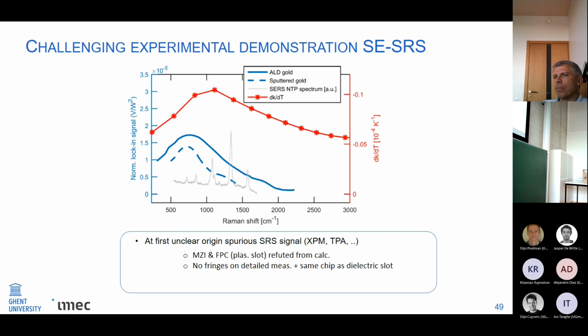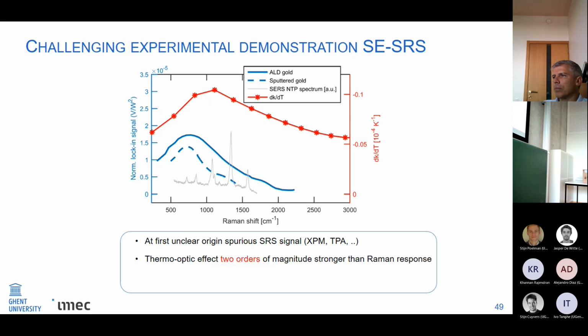But then I made a calculation for the photonic cavity free spectral range, and I can see actually that what I observe here doesn't overlap with that. And furthermore, if I did detailed measurements where I would expect these fringes to be, I also could not observe any fringes. And I also knew that I used the same chip to measure the spectrum of the dielectric slot waveguide, so I knew at least on that chip those effects should already be suppressed. And after a long time, I actually figured out this background is due to a thermal effect that's 2 orders of magnitude stronger than the Raman response.